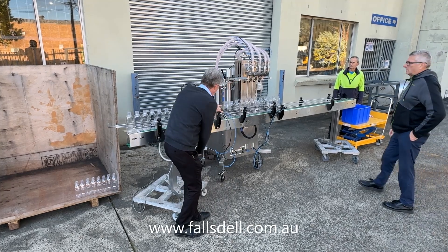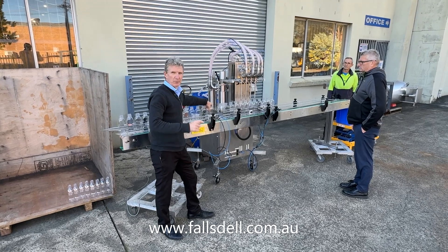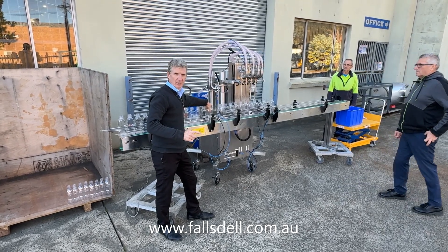Conveyor on. When this triggers, there will be a delay and then it will start. You tell me when you're ready to go.